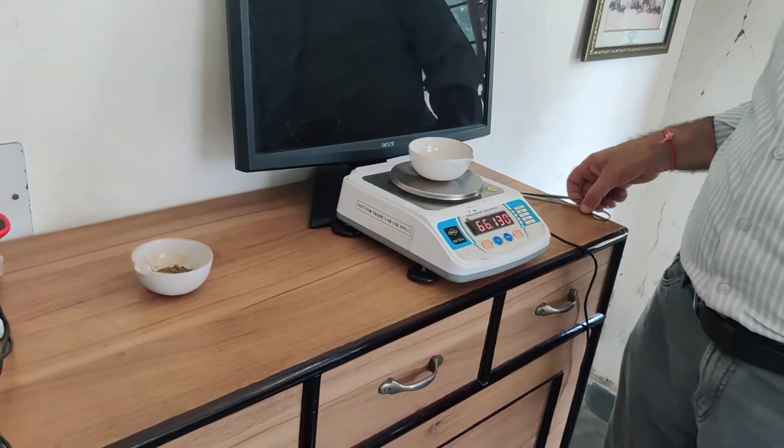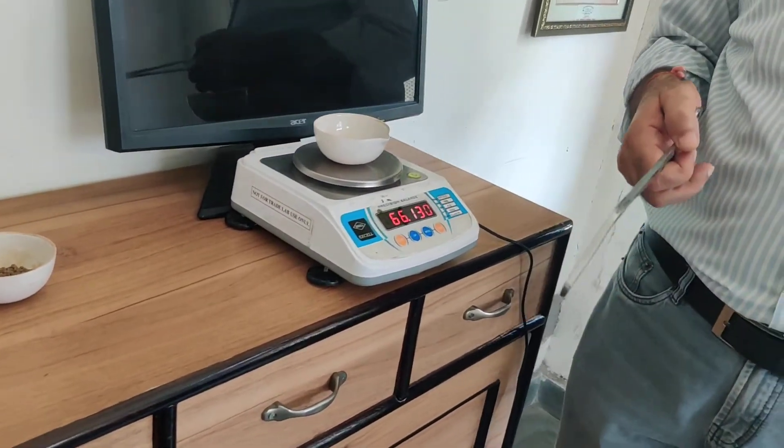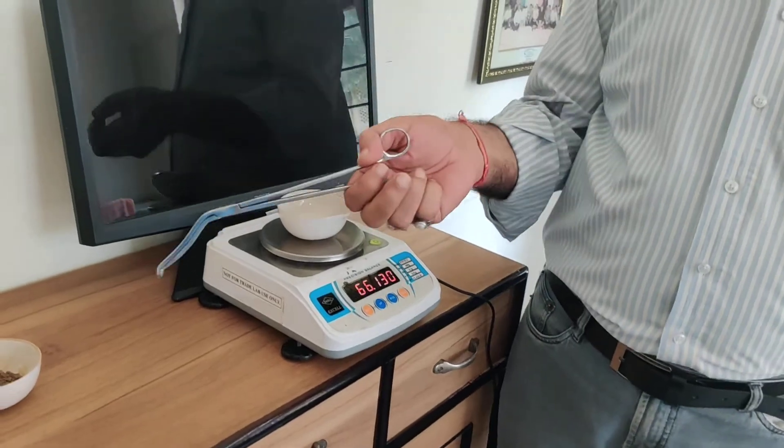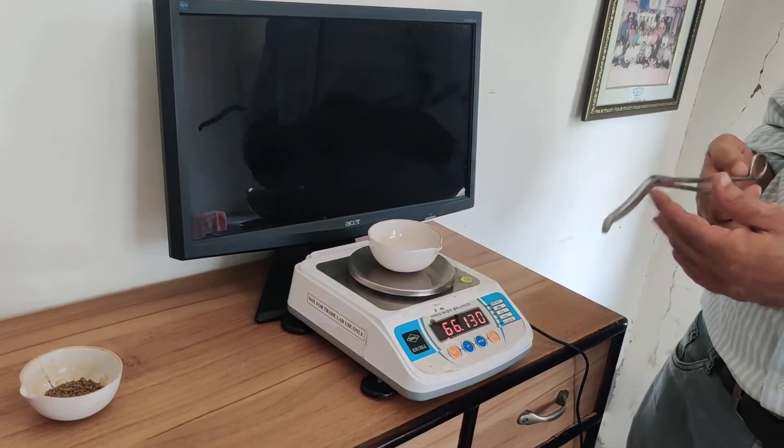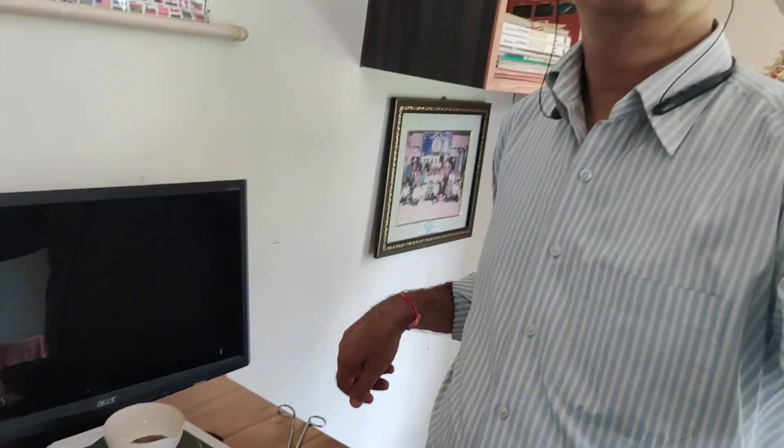So now we have the initial weight of soil and the final weight of soil. From the initial weight, you will minus the final weight of the soil. In this way, you will get the weight of moisture in these samples of soil. And by calculation, you can find out the percentage of moisture in sample A as well as sample B. Thank you.